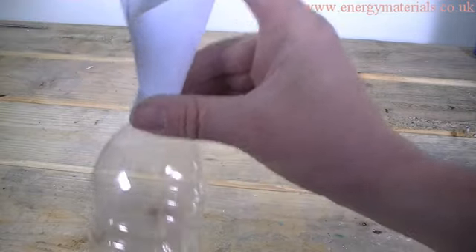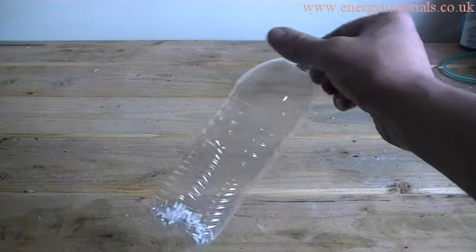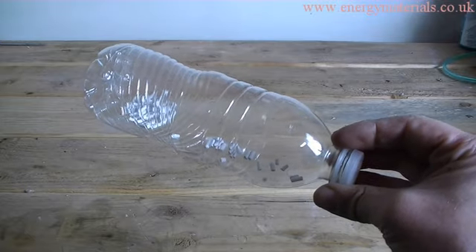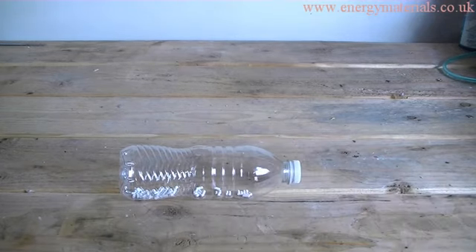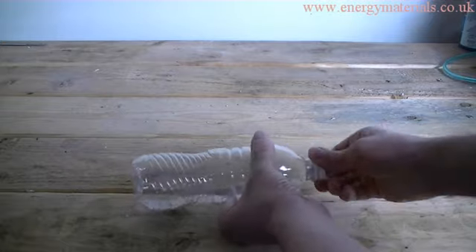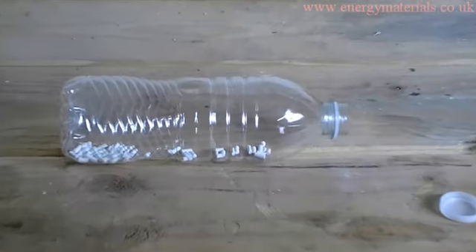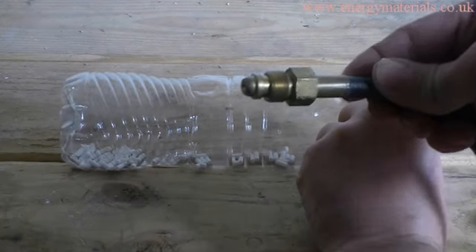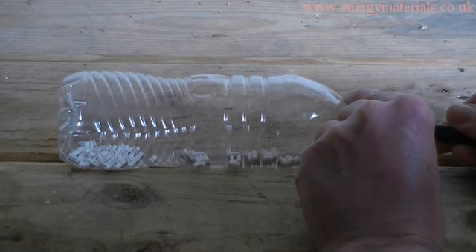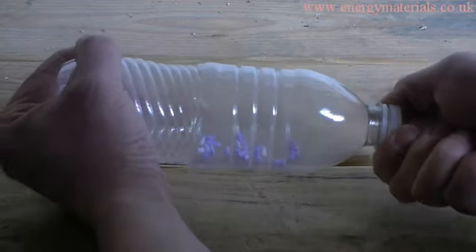Another reaction we can show is CO2 reacting with sodium hydroxide and lithium hydroxide. These white pellets contain a mix of lithium and sodium hydroxide, designed with a very high surface area to accelerate the reaction with CO2. The pellets also contain an indicator on the surface which changes color when reacting with CO2, changing from white to purple. If we place these pellets inside a plastic bottle and fill it with CO2, you can see a color change, and some water vapor being generated as a byproduct.